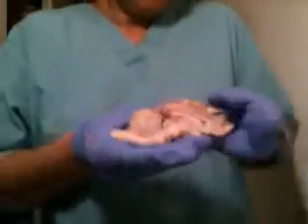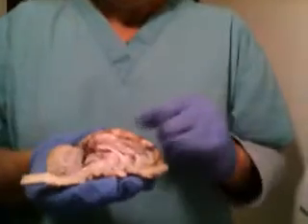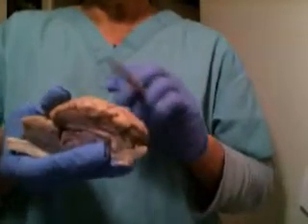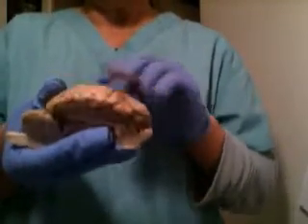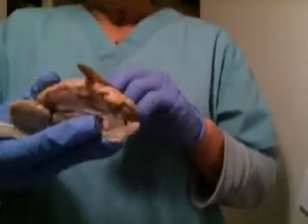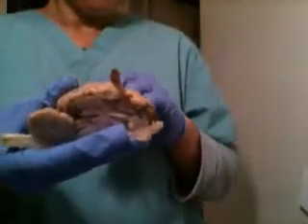Okay. Now, sagittal section of the brain, which is falling apart. Okay, now let me see. Okay, cerebrum is the large part of the brain here in the front, and the corpus callosum.